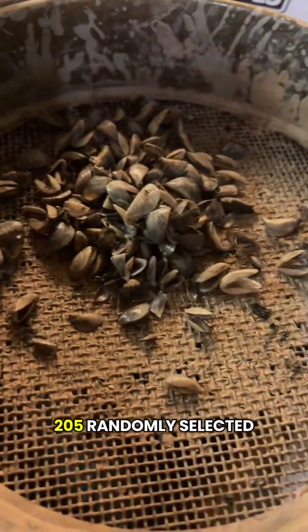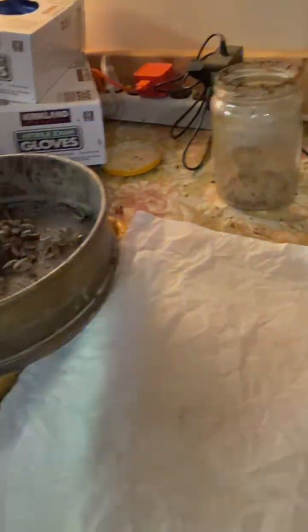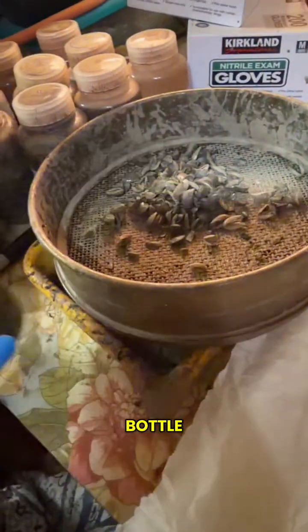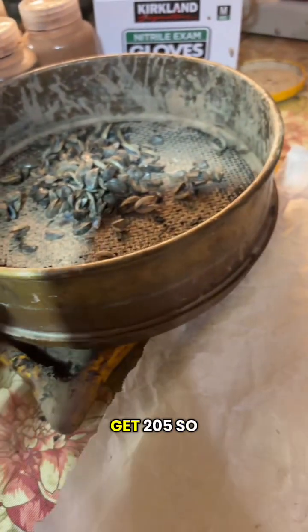All right, here's 205 randomly selected zebra mussels. I put the extra back in the bottle here. I forgot to mention that this also helps us estimate how many are in the bottle to begin with. So it took me 10 squares to get 205.